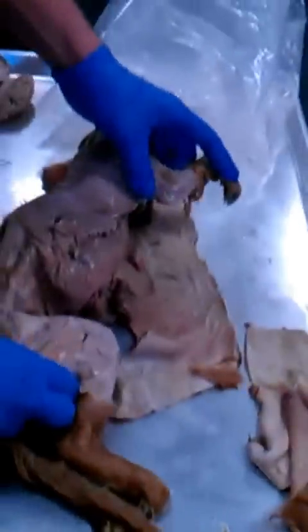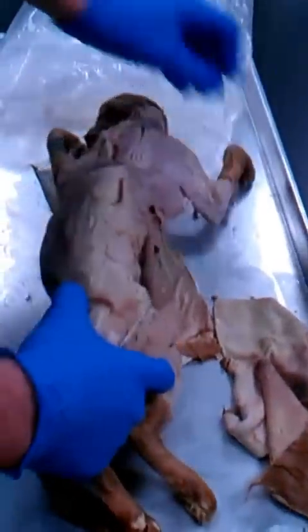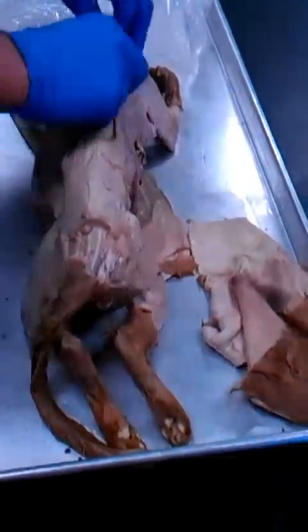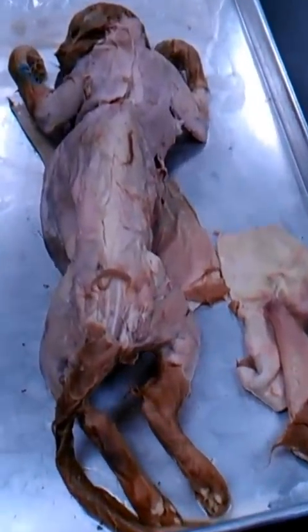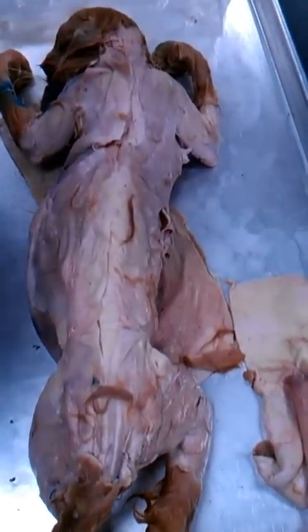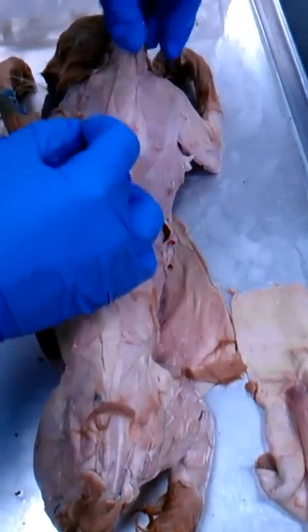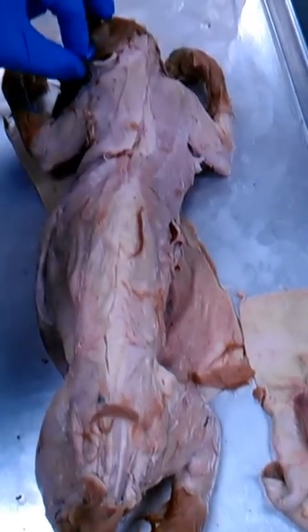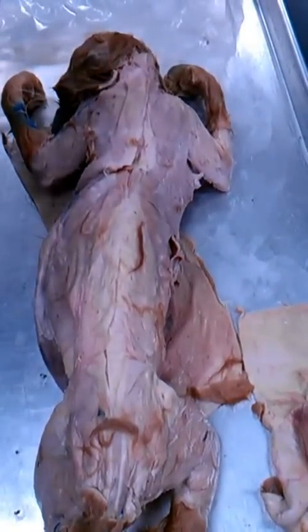Right, let's start with the muscles. Let's start with the superficial muscles. Remember, with superficial muscles, this has to be flipped shut to see it. The way this works, the first three are the ones that have the trapezius in the name. You can't really see a division, a line between each of them.